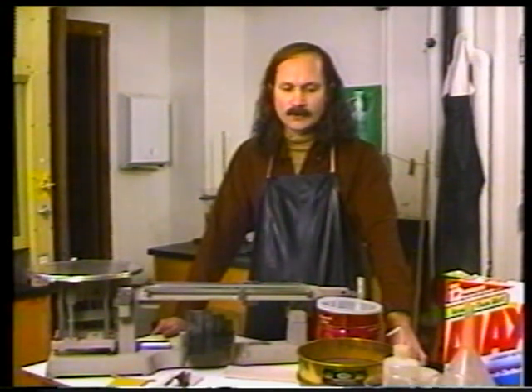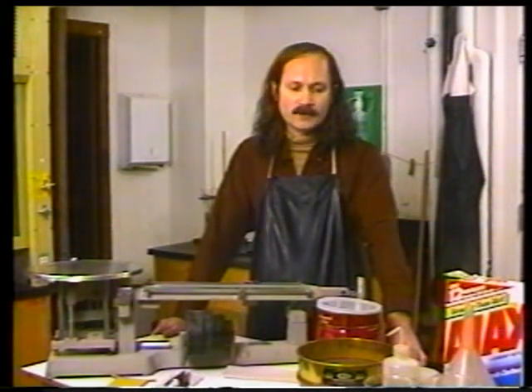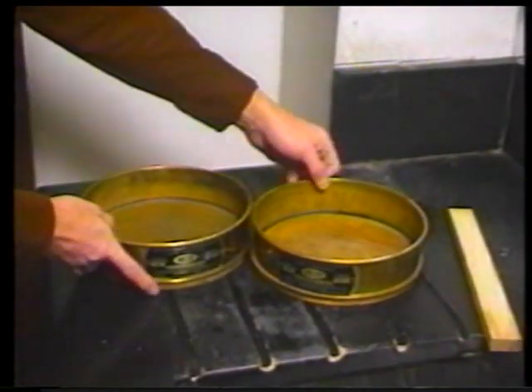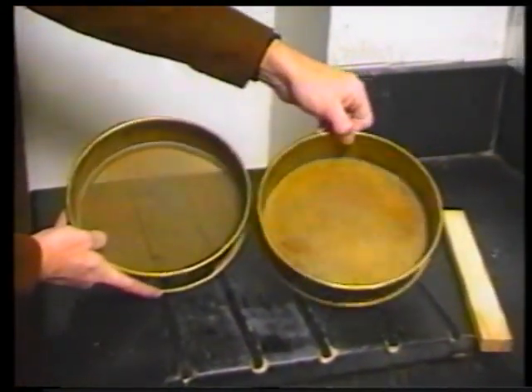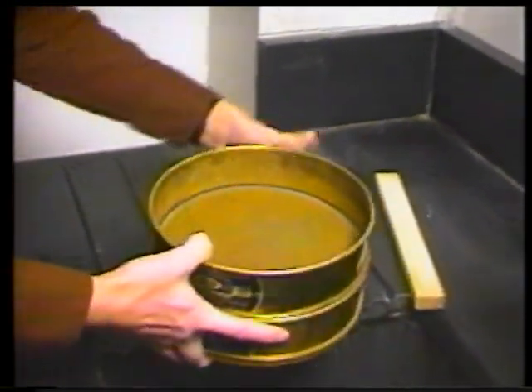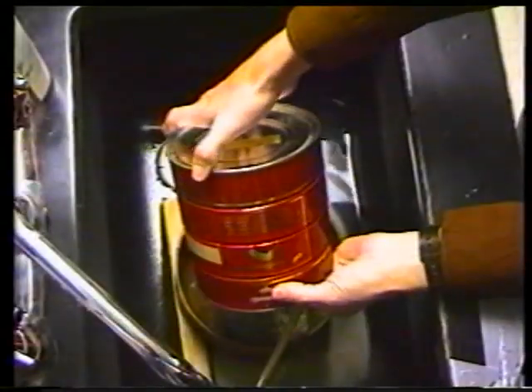You'll need two sieves for the washing process: a number 20 and a number 120 sieve. The number 20 sieve is the coarser sieve and will catch the larger fragments, but will generally not have any microfossils in it. The 120 sieve is the finer sieve and will catch most of the microfossils, but will let most of the clays pass through, which will then be washed down the drain. Another handy piece of equipment is a wooden block to prop up one end of the sieves while you're washing, which prevents air from being trapped underneath the sieves.